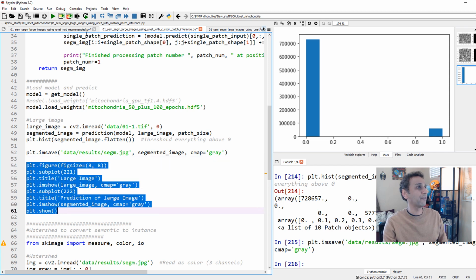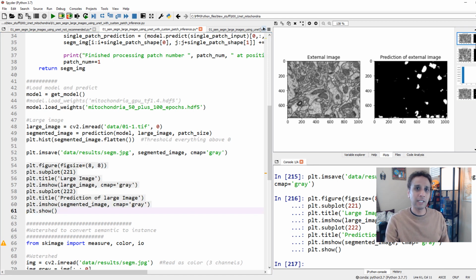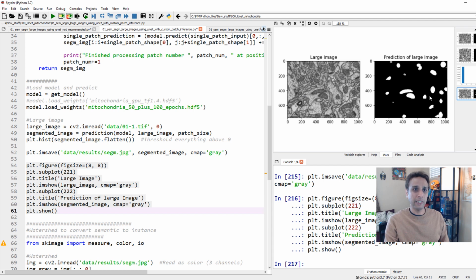If you are visual like me, you want to have a look at it. Look at this output compared to what we had before when we did this in the wrong ways, right? These are all the wrong ways, and here is the right way. So your image and the segmented. And there are some issues, like a little bit of noise. We'll clean that up in a minute actually. But overall, you can see how nice this is. You have these mitochondria. It could have done a better job down here. It's a matter of training our model in a better way. But I see these two mitochondria are close by, and we can separate this.